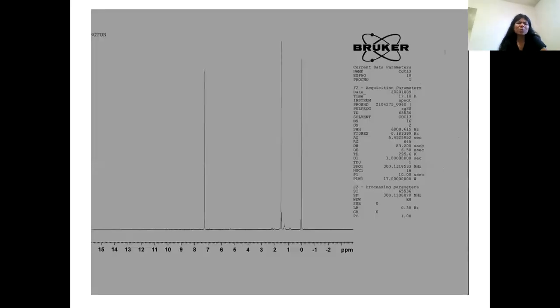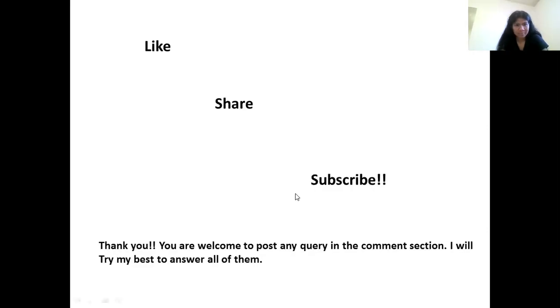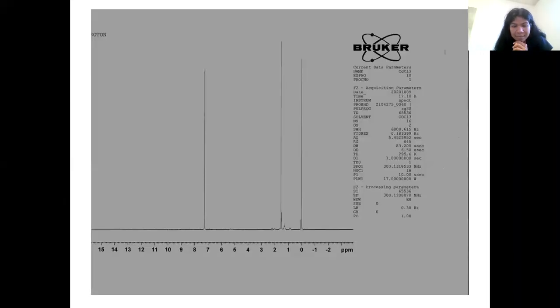Now let me show you the specific solvent proton NMRs. I am showing this because I have recorded the solvent NMRs themselves, taking only the solvent without any compounds. As you can see, this is a CDCl3 NMR, and there are peaks at 0, at 1.5, and at 7 point something, around 7.2. These three peaks are due to the CDCl3 solvent itself. Whenever you take any NMR in CDCl3, you will see these three peaks. All three will always be present.